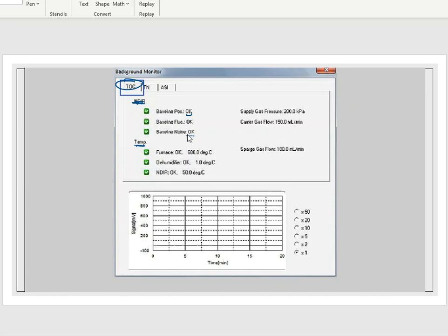All three of those are in reference to what the NDIR is seeing. So the NDIR needs to be very stable, which means a pretty flat line needs to be there if no sample is running through it. So if I'm not running sample and I'm starting to see a little bit of this that comes through the NDIR detector, then I know that there's a contamination issue. So the machine is going to let me know there's a problem and you need to fix it. And I need to fix that problem and turn the machine back on, and hopefully I can get rid of all of this noisy kind of baseline that begins to happen. So the positive, the fluctuation, and the noise is really all related to that particular type of line.